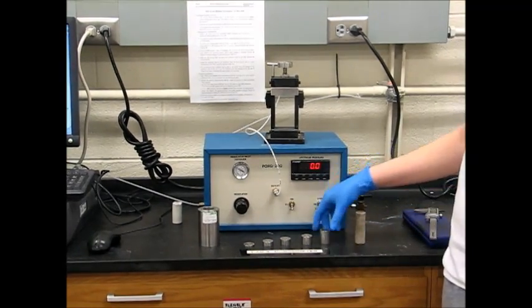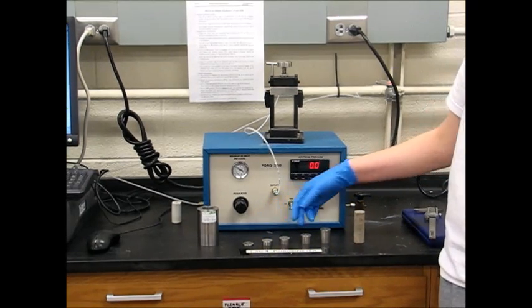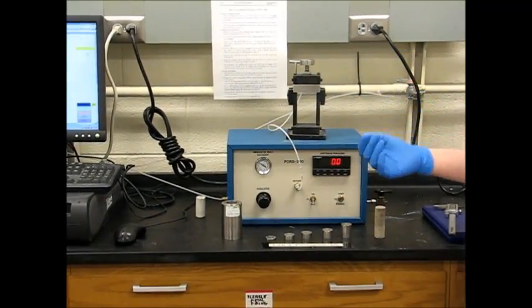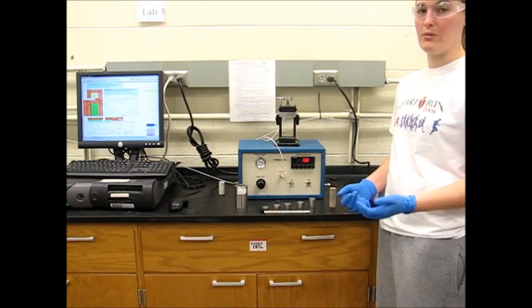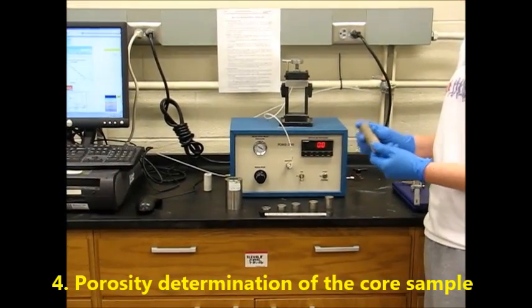So after we get P1 and P2 from all of our different samples and the combinations, we're going to plug it into our Excel sheet, which will give us a standard curve. We'll fit a line of best fit to that curve, and that will give us different coefficients that we'll use later. After obtaining that, we're going to use the core sample.